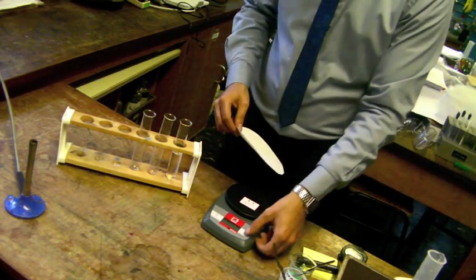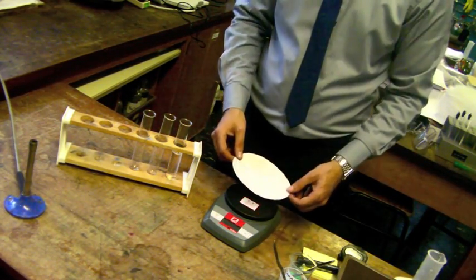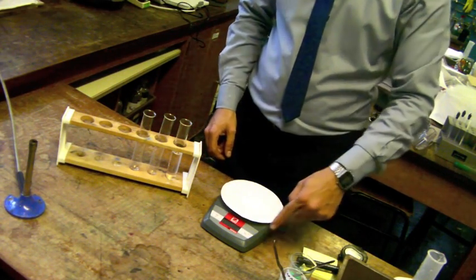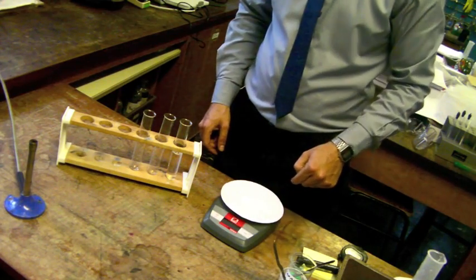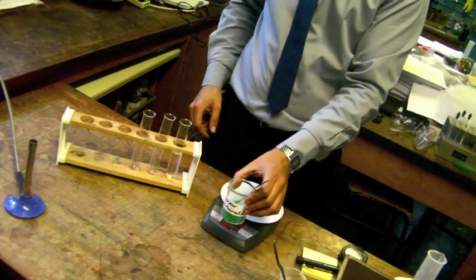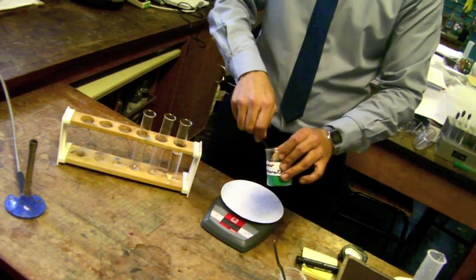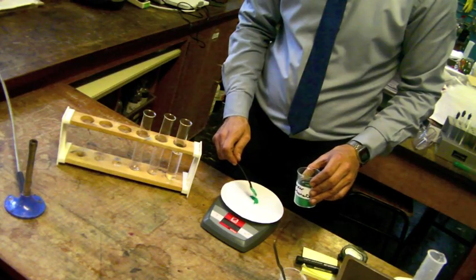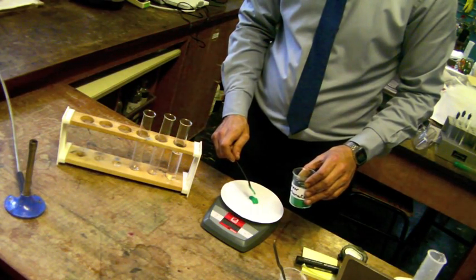We will be measuring out our carbonate onto a piece of filter paper. Place the filter paper on top of the electronic scales and then zero the scales. Let's start with copper carbonate. Using a spatula, gently measure out exactly two grams of copper carbonate onto the filter paper.